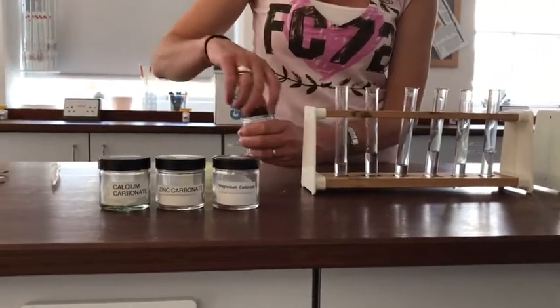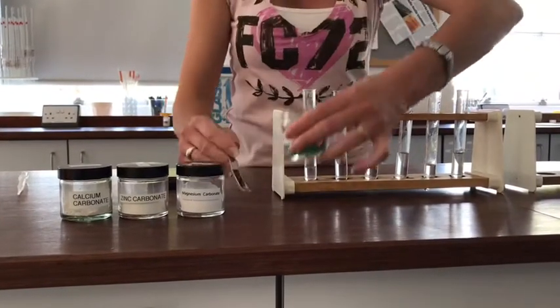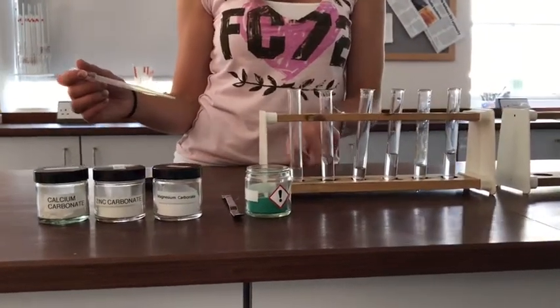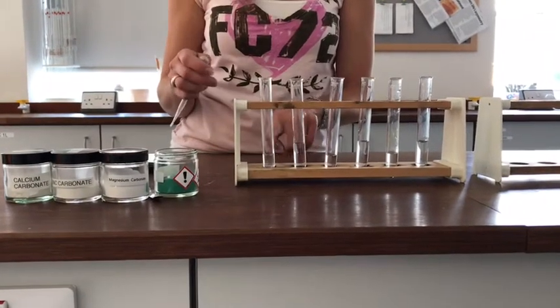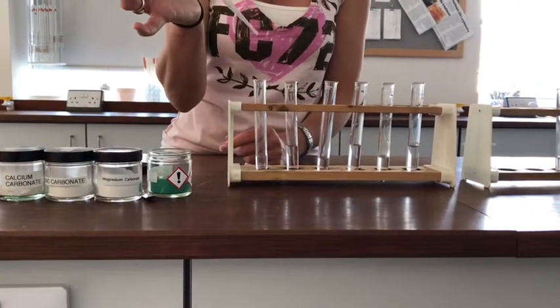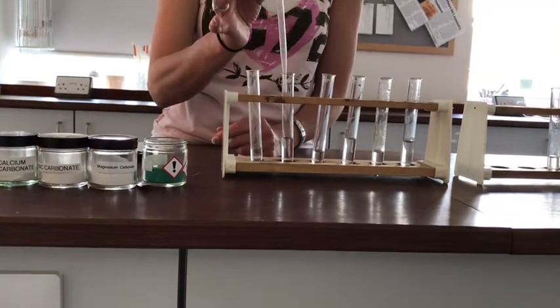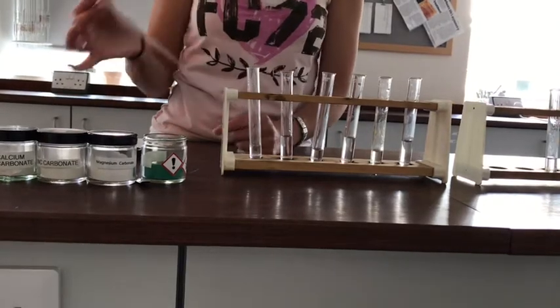So my strategy is this. I'm going to add some of the powder to the acid. Then as it fizzes and bubbles, I'm expecting that the carbon dioxide that forms will stay low down in the tube there because it's got quite a high density. It sinks in air effectively. And I'm going to use the dropper to collect that CO2 from down there by sucking it up in my dropper, and then I'm going to bubble it out through the lime water that's in the tube next to it. So this is my plan.